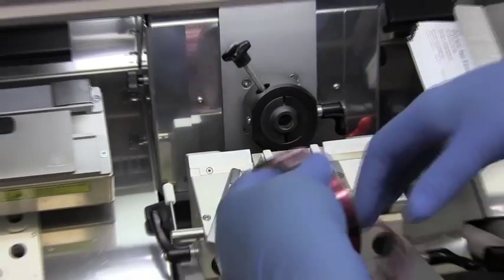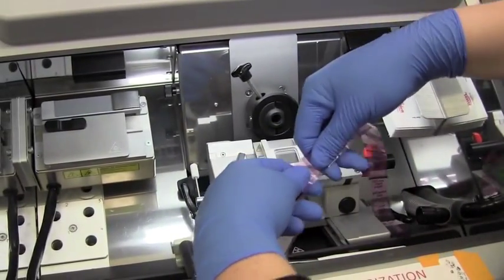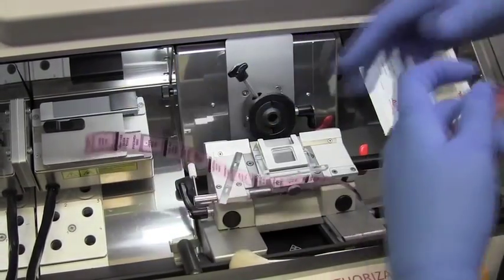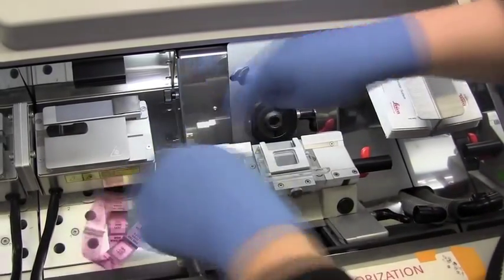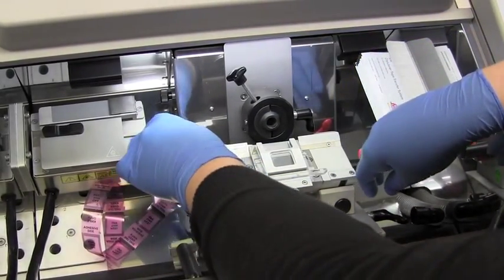I usually put the slides there. I break off some tapes. I keep them down here where they can be cold, and then I mount the blade.